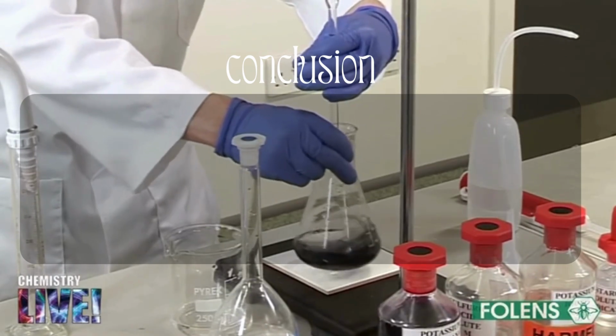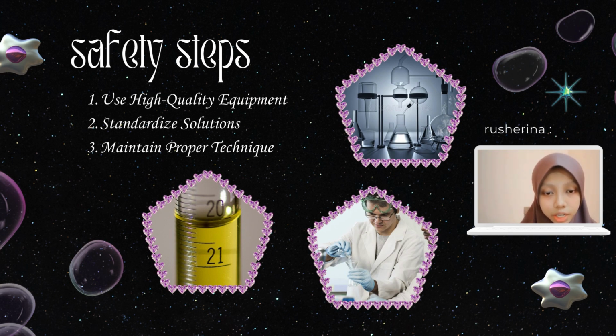was calculated. To reduce error in titration and improve the accuracy of our results, we should use high-quality equipment. Ensure that we use high-quality glassware, burettes, pipettes, and other equipment. Calibrate our equipment regularly to ensure accuracy. Other than that, we should standardize all solutions used in the titration process to ensure accuracy. This includes the titrant solution and any solution used for calibration.